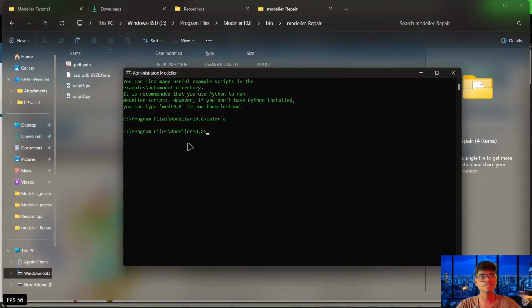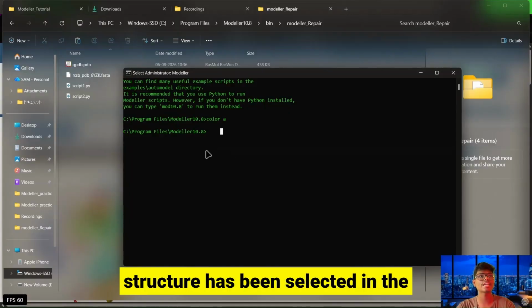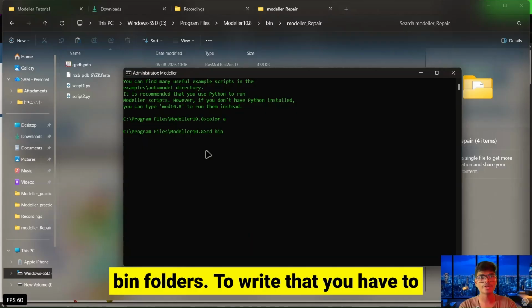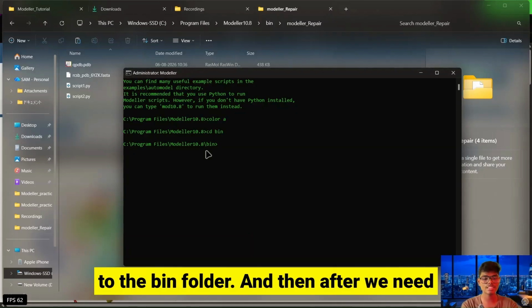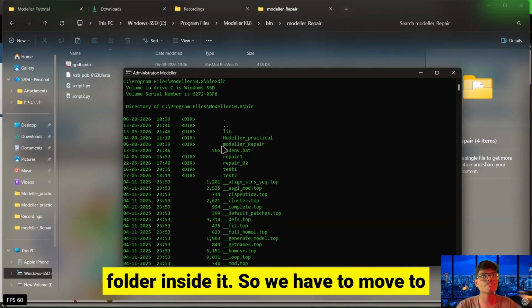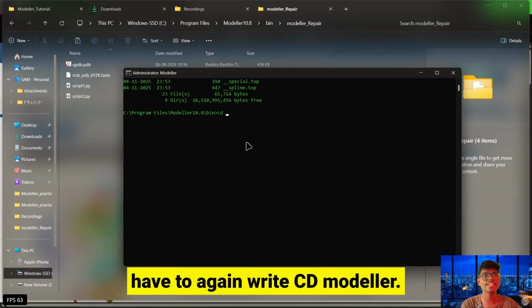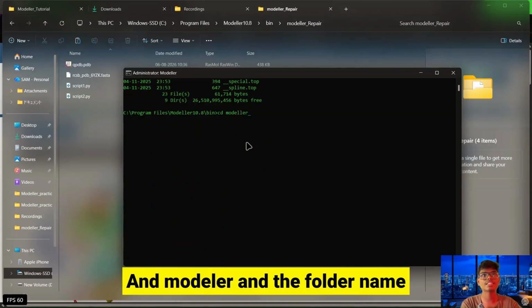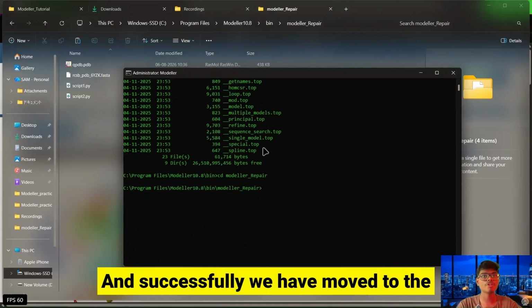So the default path of this protein structure has been selected in modeller 10.8, and we have to move to the bin folder. To do that, you have to use the command cd bin. Then let's check the directory, because we need the modeller repair folder inside it. So again write cd modeller and the folder name, that is modeller repair, and successfully we have moved to the modeller repair folder.